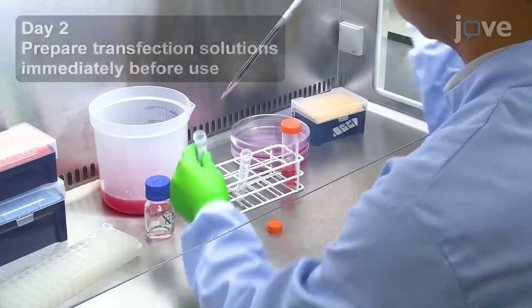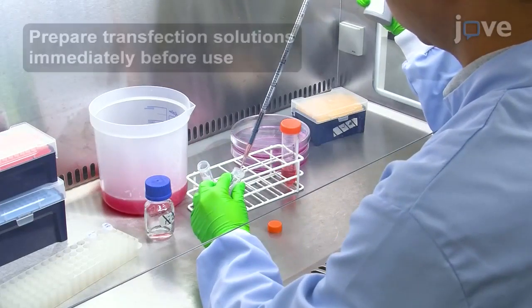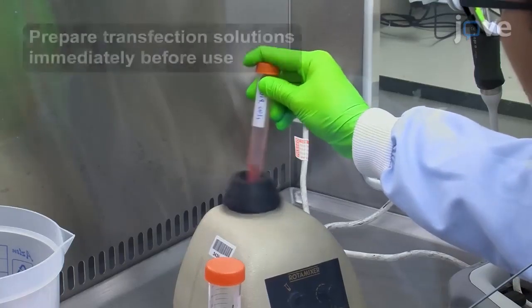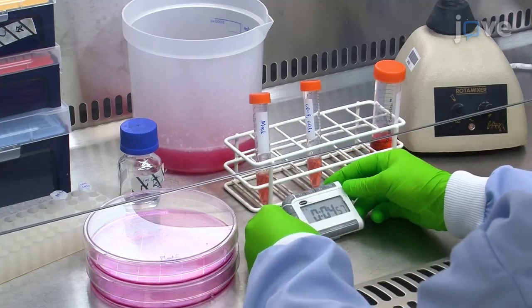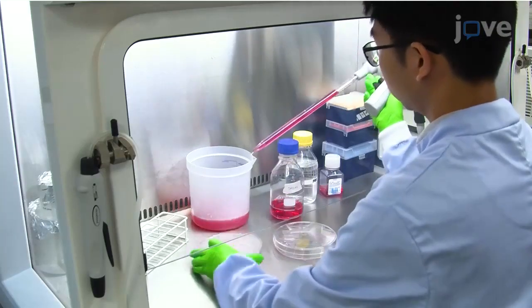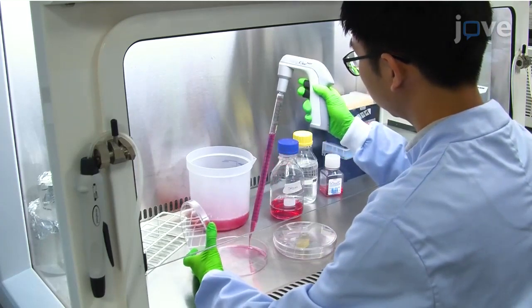The next day, prepare 3 milliliters of transfection solution 2 for each dish as outlined in the text protocol. Vortex this solution for 10 seconds and then let it rest for 5 minutes. Remove the medium from the dishes and replace it with 12 milliliters of transfection solution 1.